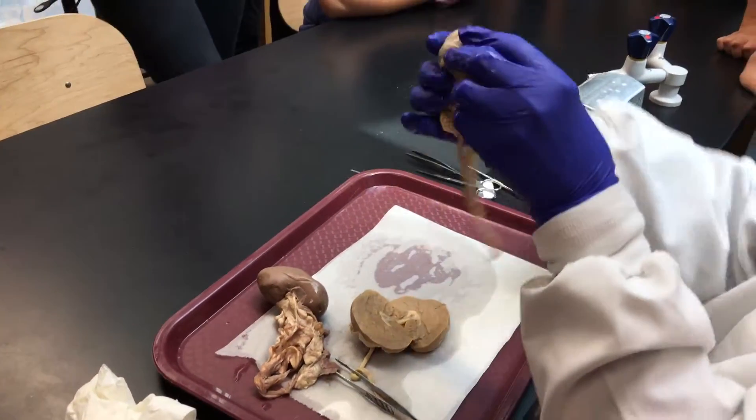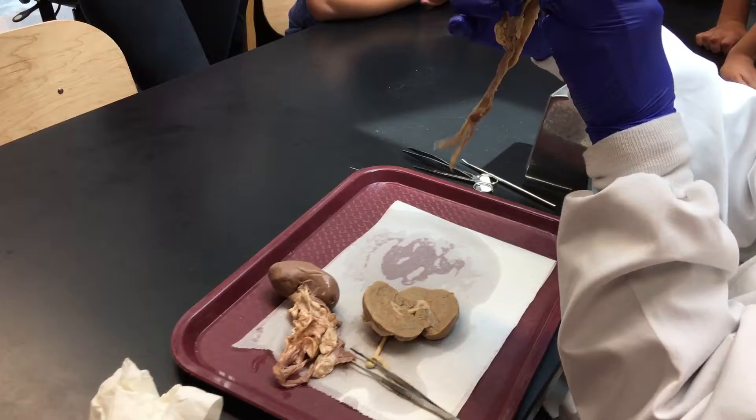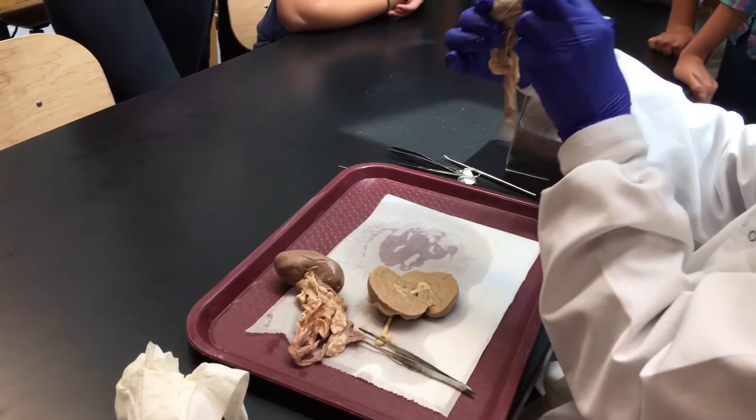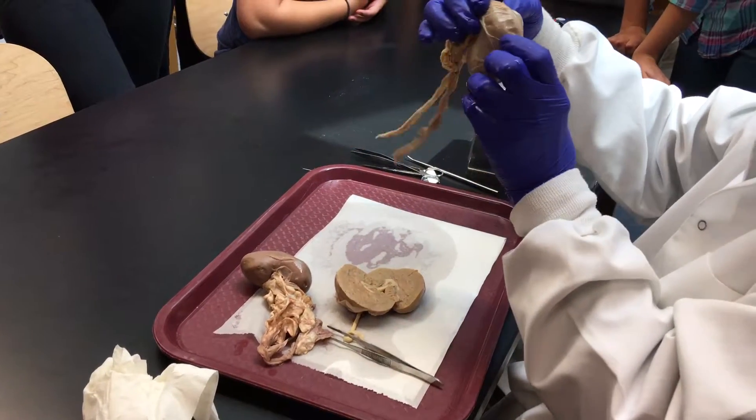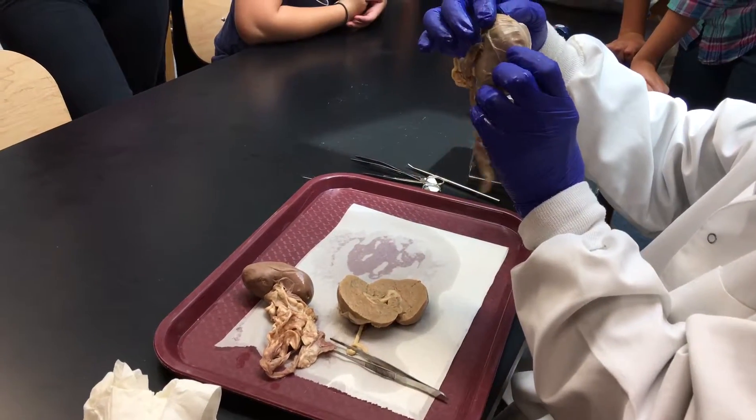In the case of sheep, the kidney will be oriented like this. In our case, it will be oriented like this.